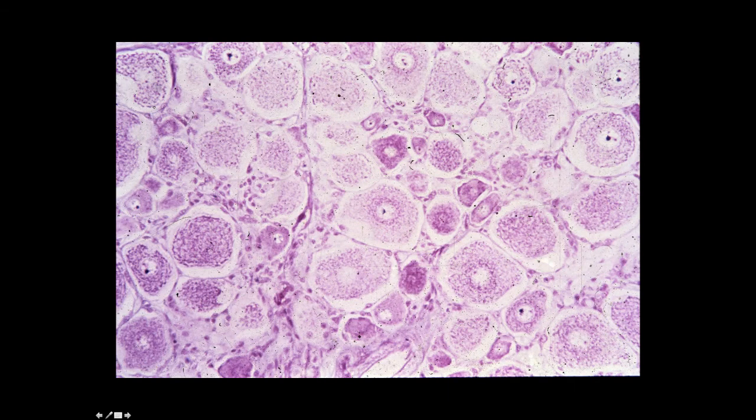In a higher power view of the spinal ganglion, you can identify nerve cell bodies. These big cells are the nerve cell bodies. Maybe right here would be part of the axon hillock, and in some of these nerve cell bodies you can get a sense of the nucleus and nucleolus. You can see the punctate staining of the cytoplasmic Nissl substance, and you can see some smaller cells, which would be supporting cells or satellite cells around these ganglion cells.